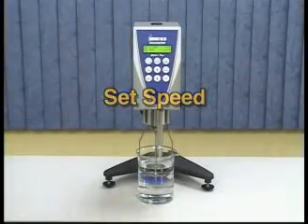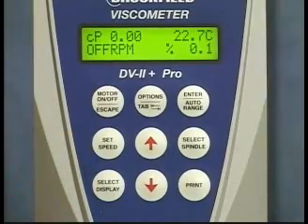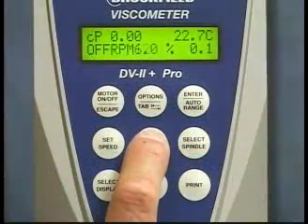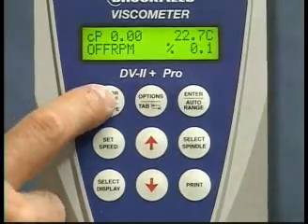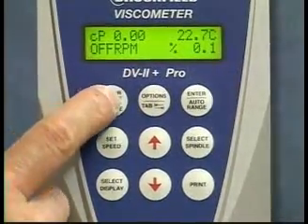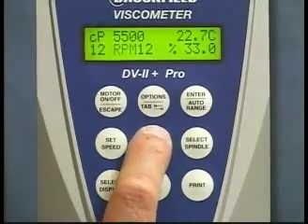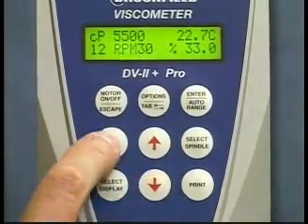Set speed. The set speed key is used to select from the 54 available speeds on the DV2 Plus Pro. With the motor off, use the up/down arrow keys to select a speed, then press the set speed key. When the motor is turned on, your selected speed will be displayed and run. You can also change speeds with the motor on — press the up or down arrow keys to choose the appropriate speed, then press the set speed key again to enter it.